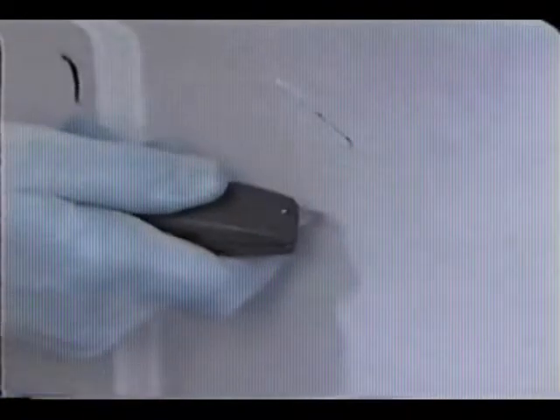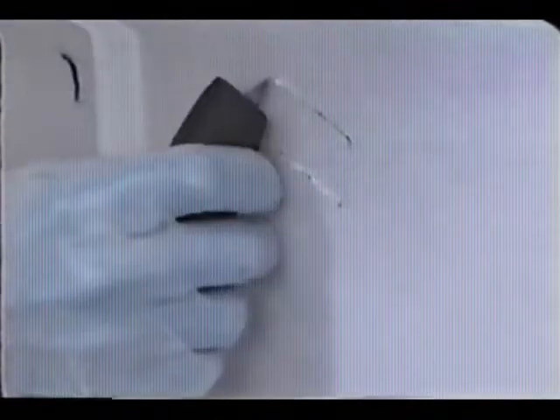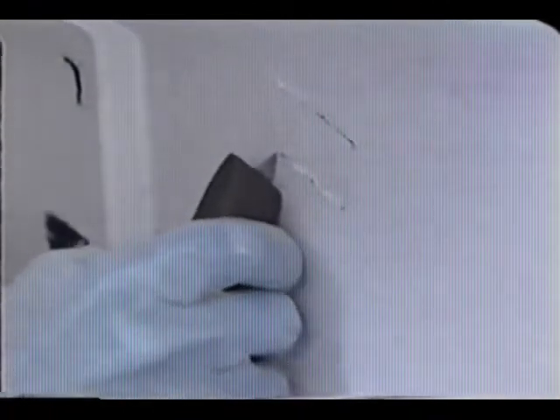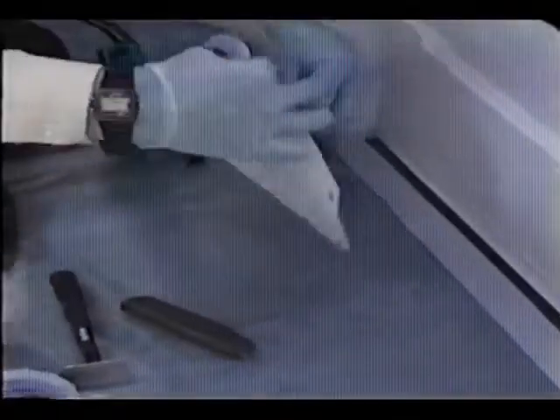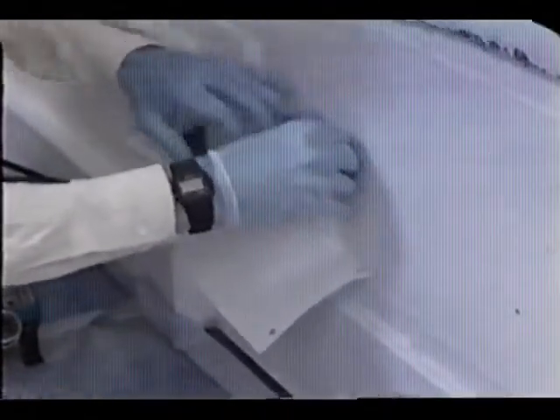If sample results will be reported in milligrams per square centimeter, before scraping, you must measure the sample area exactly using a ruler and score the area with a razor-sharp edge. When using a heat gun, be careful to apply only enough heat to soften the paint without making the paint smoke or char.